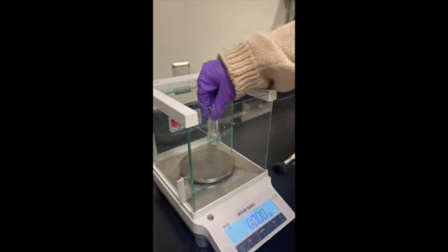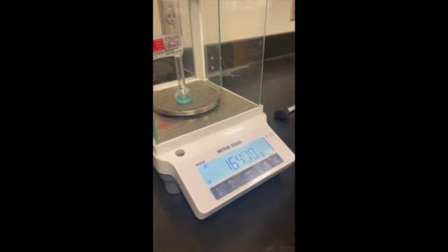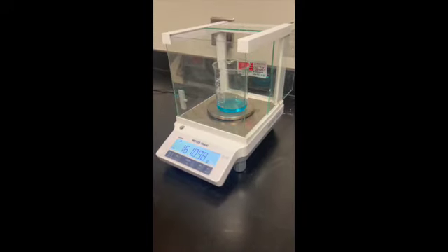Now, after taking our last measurement of the beaker, it was time to do the math. To finish out our experiment, since everything could be washed down the drain, we simply cleaned all of our tools with soap and water and put them away.